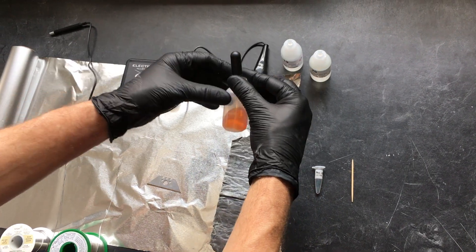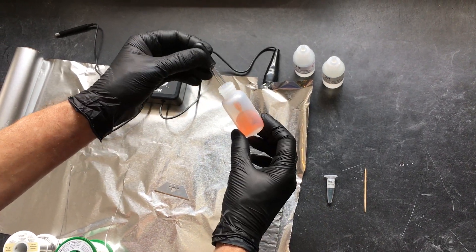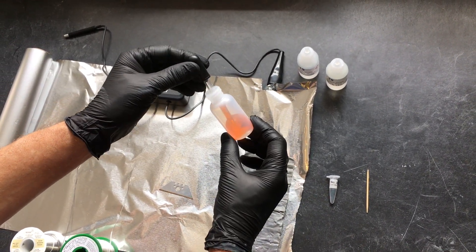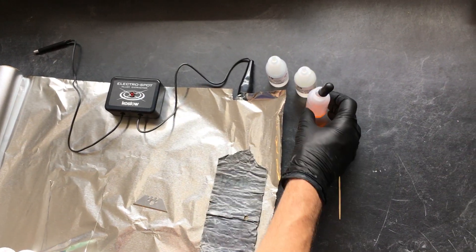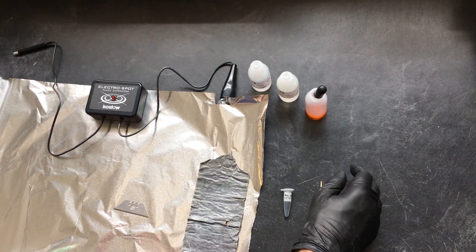So you're hoping to make sort of like an orange soda color. Check the instruction manual, it'll explain a little more details on how to make that. It's very easy to make. So here we go.